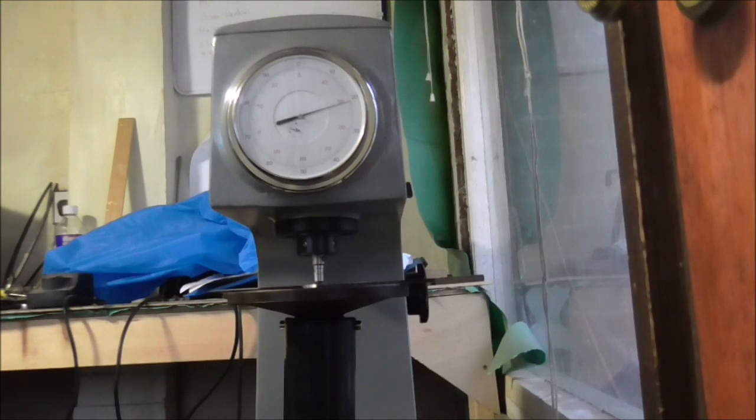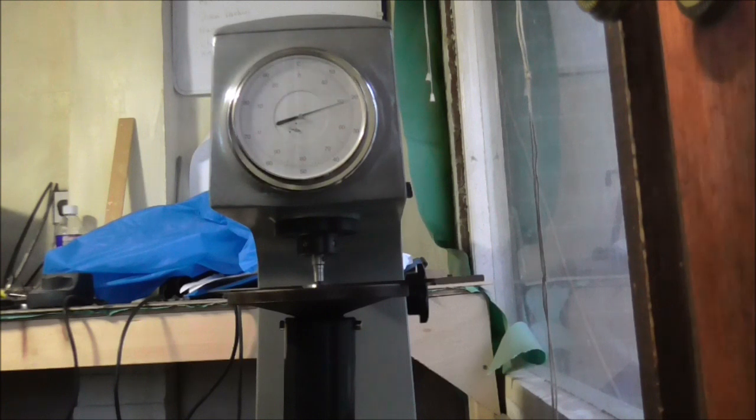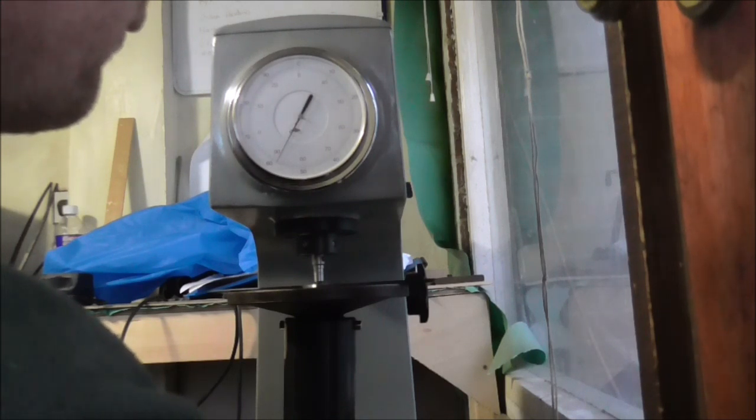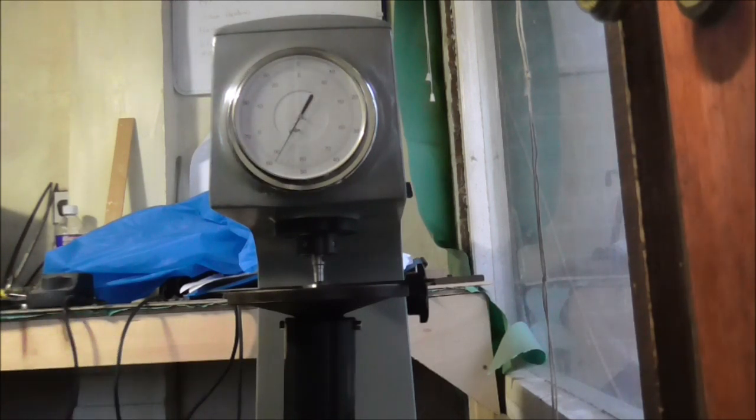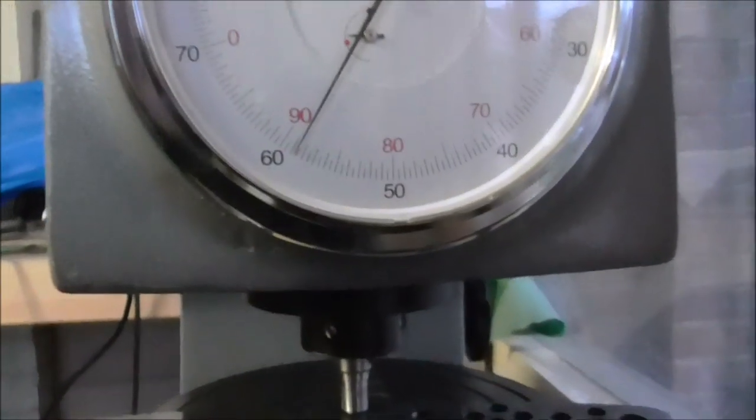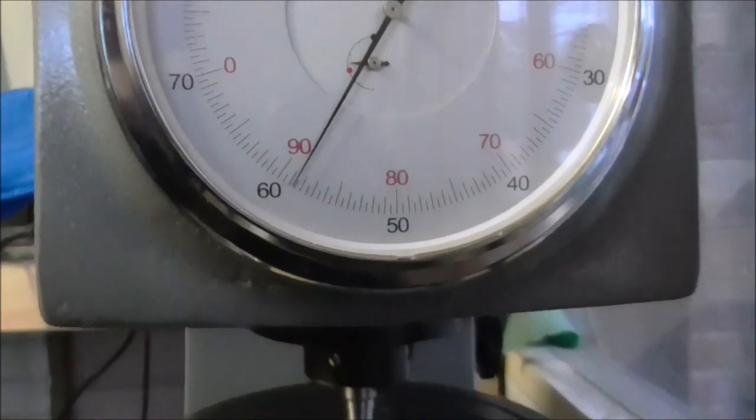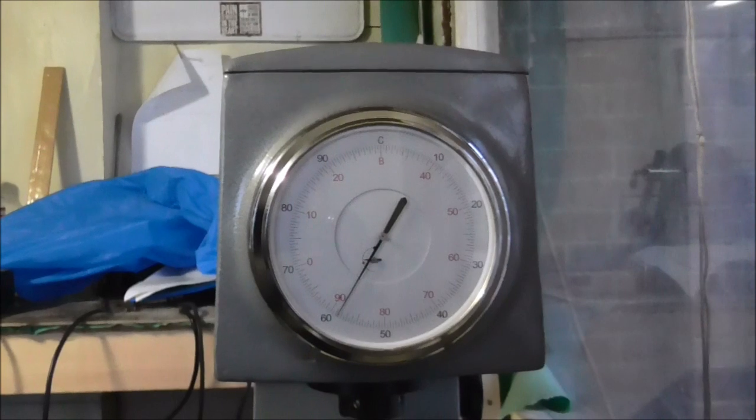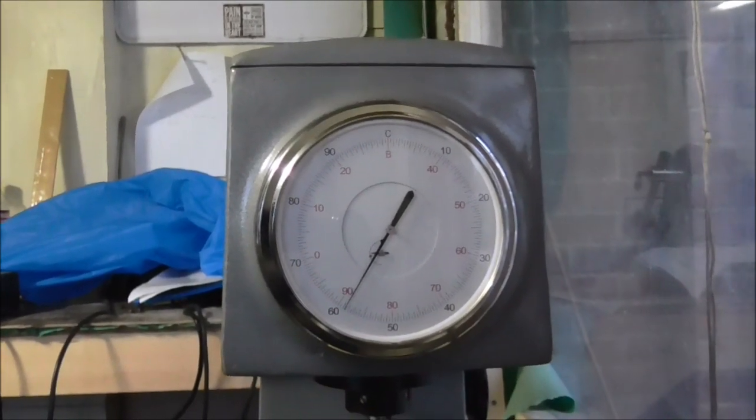Let it settle for a bit. And then I'll see what the Rockwell reading is. The Rockwell reading of that knife is 59. 59 HRC. I'm pretty happy with that.